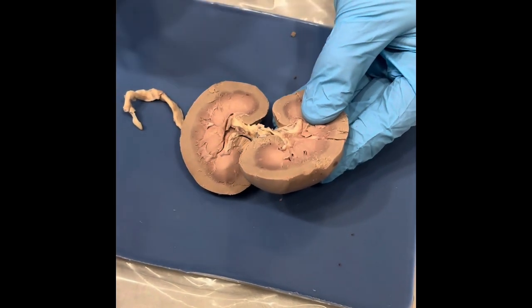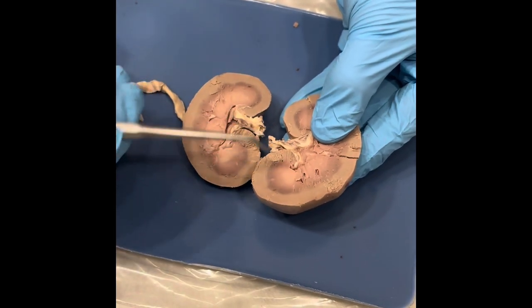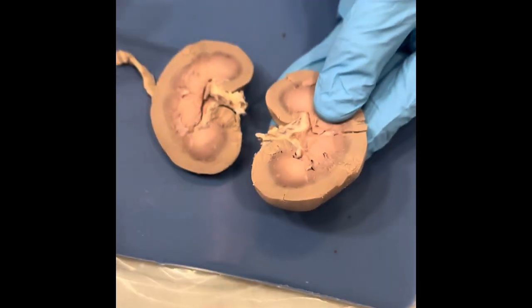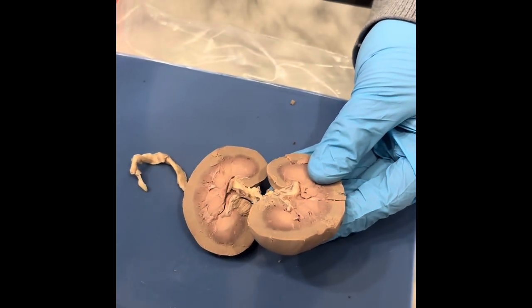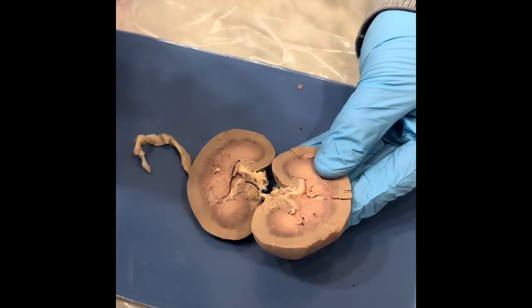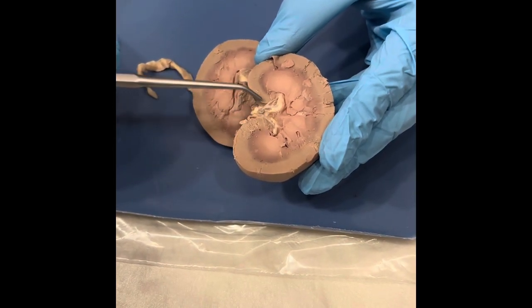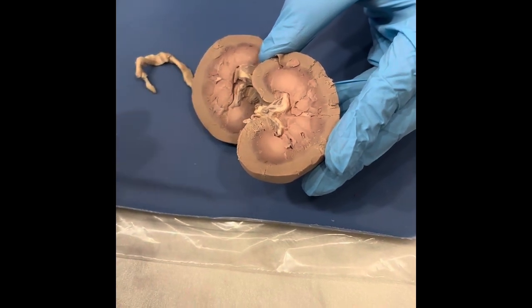Now the renal papilla discharges urine into a cup-like structure called a minor calyx. These are kind of hard to see on this one, but here's a pretty good view right there underneath the apex. So each pyramid has a minor calyx, then it merges into a major calyx, or calyces, which would be all in here. The calyces then merge together to form the renal pelvis, which is this large cavity here that receives urine from the major calyces and then flows into the ureter.